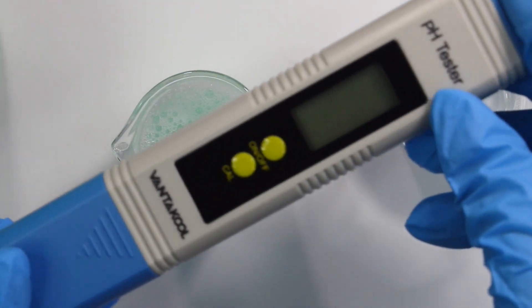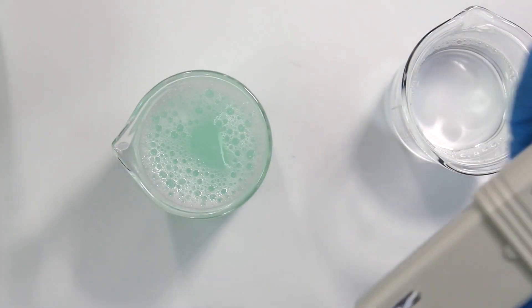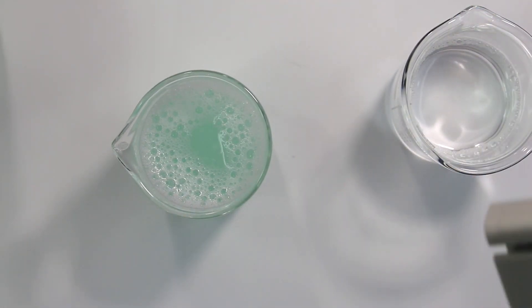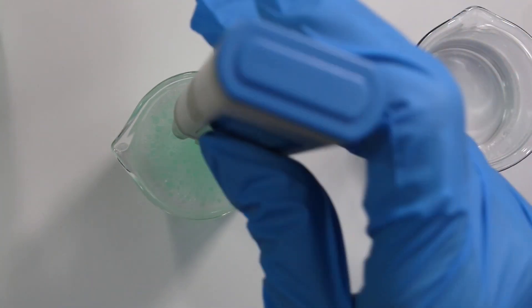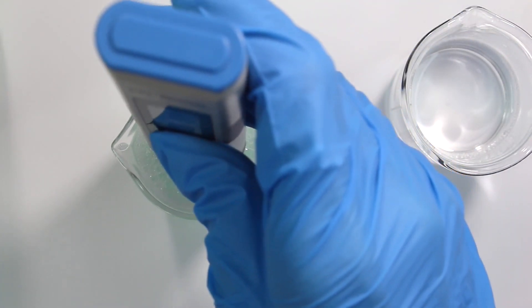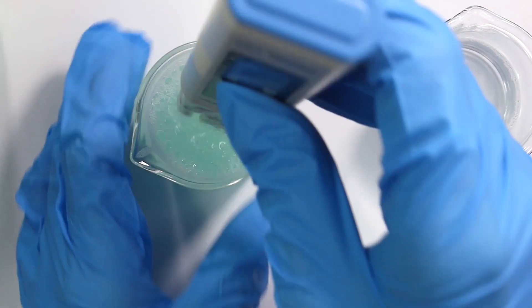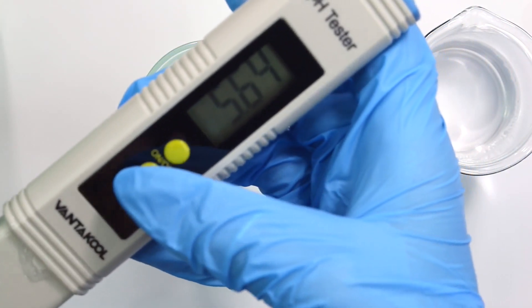And I actually wanted to show you guys my old pH meter, how the pH level is different from the new one I got. So of course I'm just rinsing it and distilled water real quick before I place it into my diluted solution. And then I will just let it set my diluted solution for about a minute, make sure I get a stable pH and it's reading 5.64.